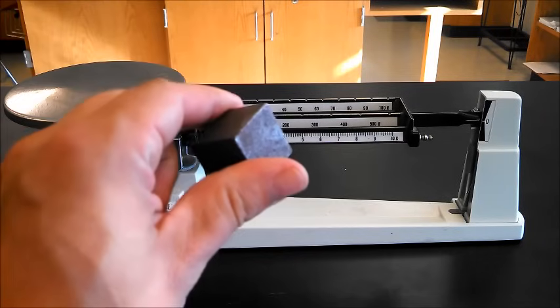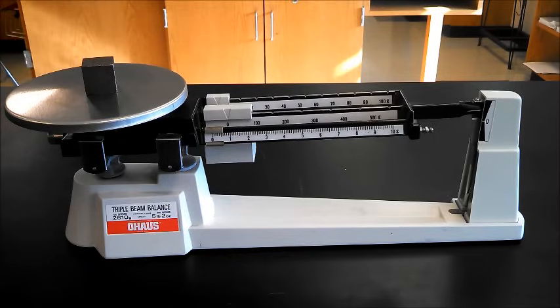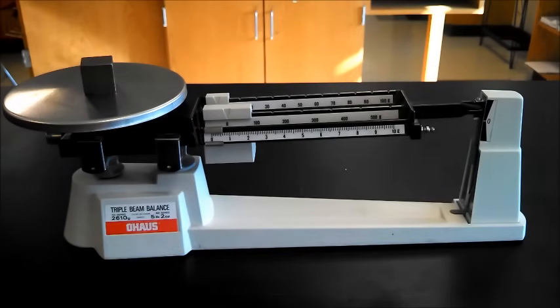So, let's take the mass of this iron cube. We'll put it on here. You know right away, this end goes right up to the top.